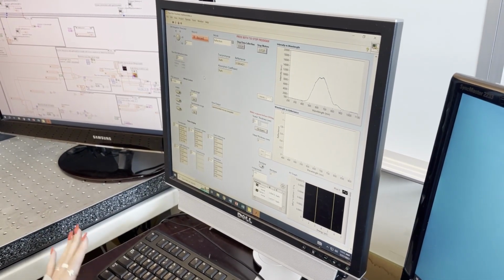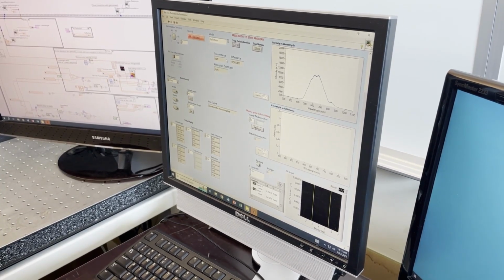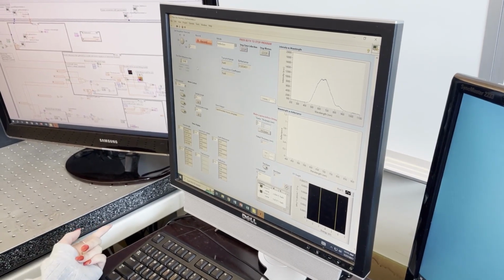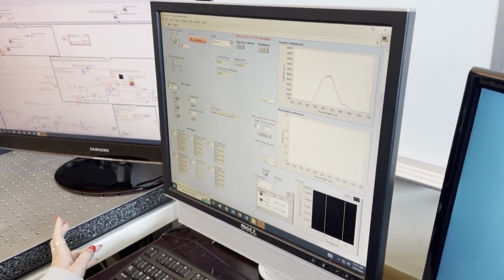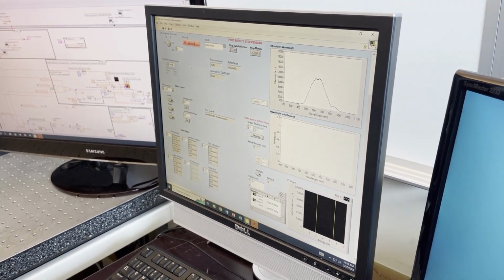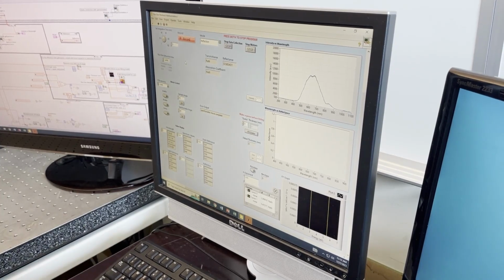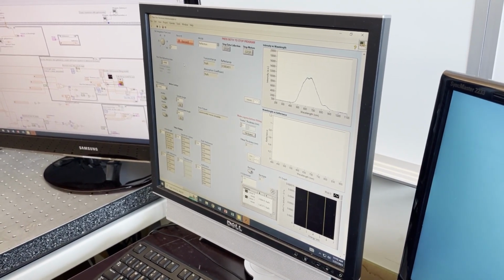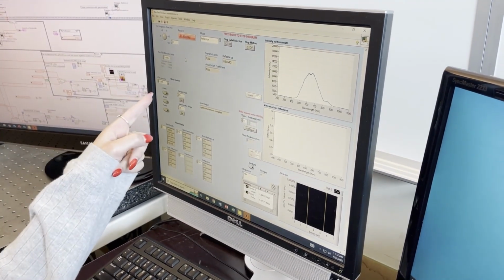Now that you have all three of those measurement types that you're satisfied with, you're going to want to specify the refractive index of the thin film. If you don't do this and leave that blank, it's going to error. And then once you error this program, it abruptly stops communication with the spectrometer without closing it properly. So the next time you try and run the program, it won't be able to start communicating with the spectrometer, and then you're going to have to restart the whole computer. So make sure you fill in that box.